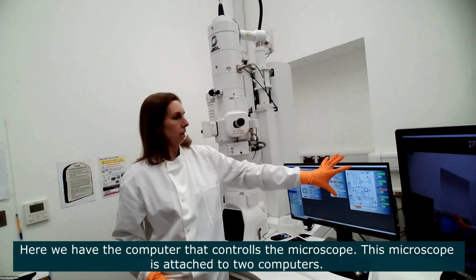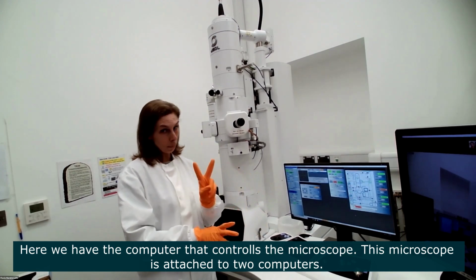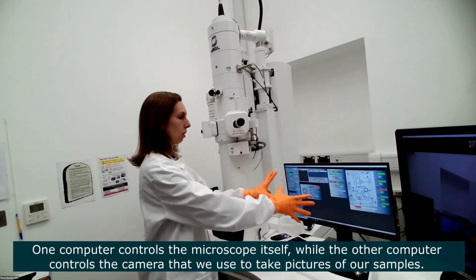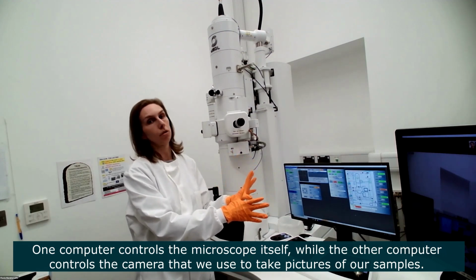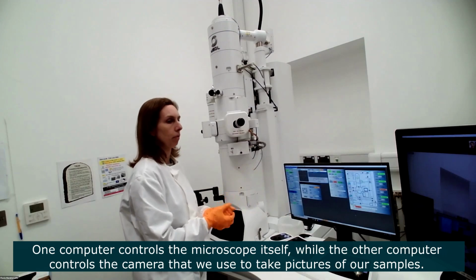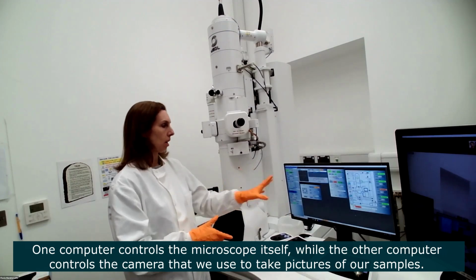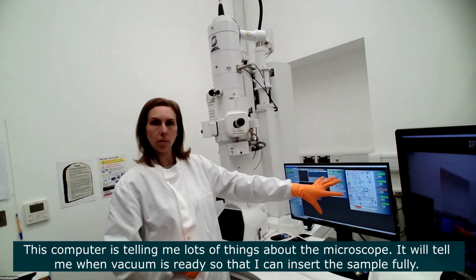Here is the computer that controls the microscope. This microscope is attached to two computers. One computer controls the microscope itself, and the other controls the camera that we use to take pictures of our samples. This computer is telling me lots of things about how the microscope is working.